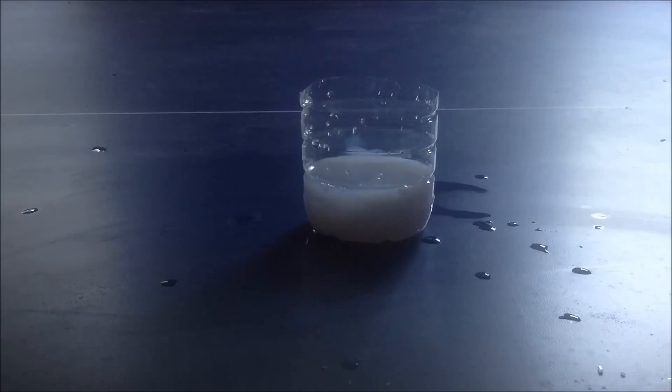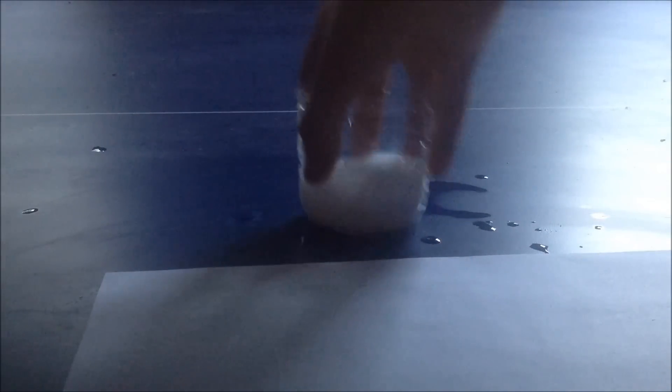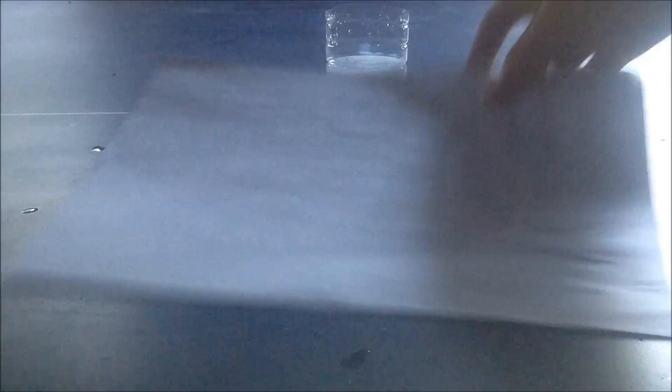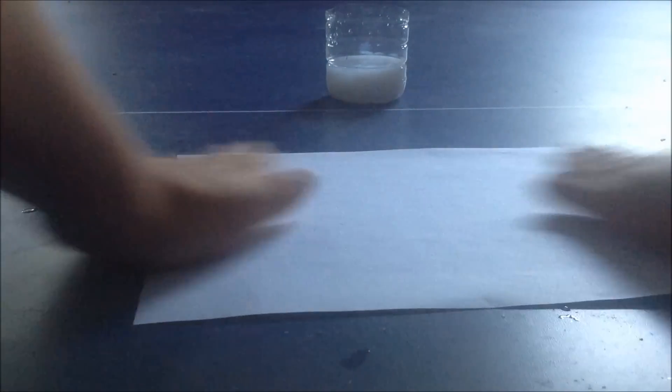So while it reacts a bit more, I'm going to explain the science behind the reaction. Paper is a bit wet from the water everywhere.